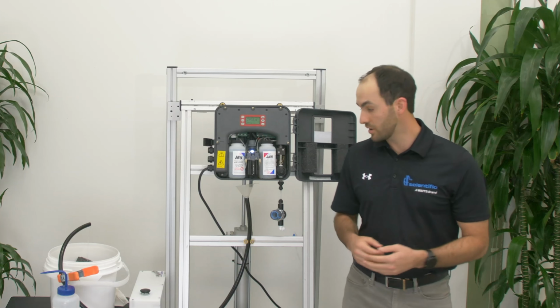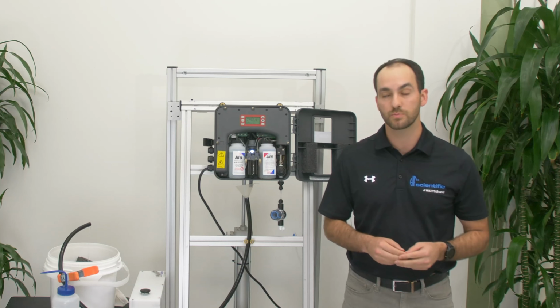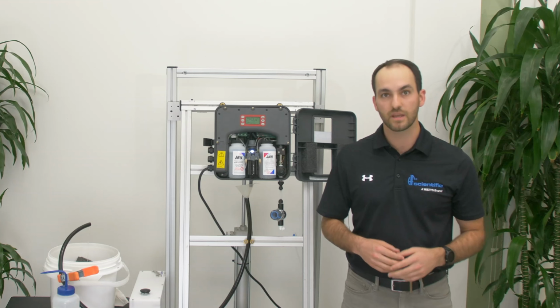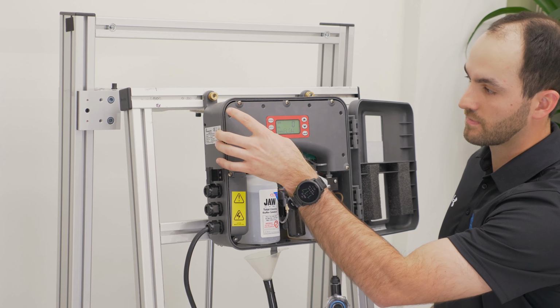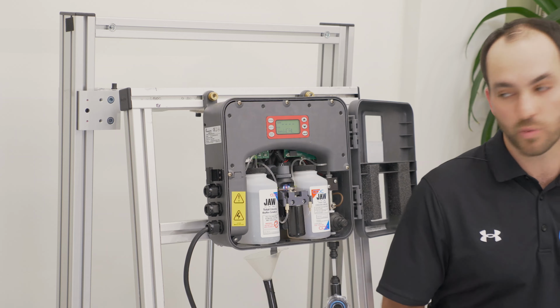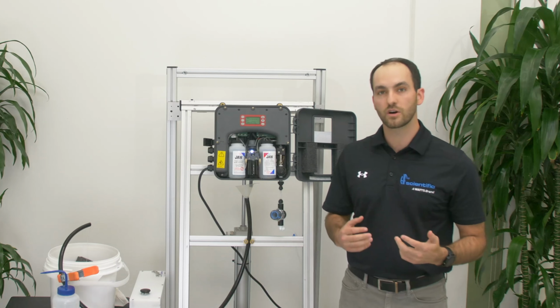We have now installed a funnel on the bottom of the CLX. We no longer have a tube attached to the hose barb. We're going to try to drain the cuvette and see if it drains. If it drains and clears the NPRG, we know we have solved the issue. As we can see, once I hit the exit button twice, the cuvette drained. So that told me that the tube on the bottom was our issue.